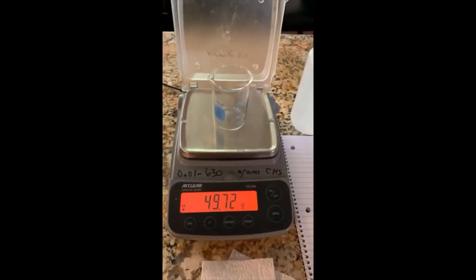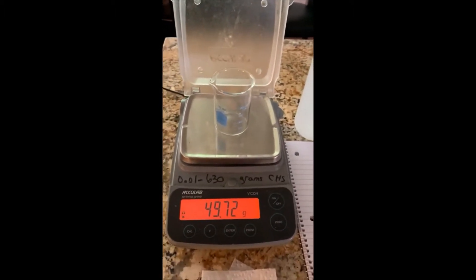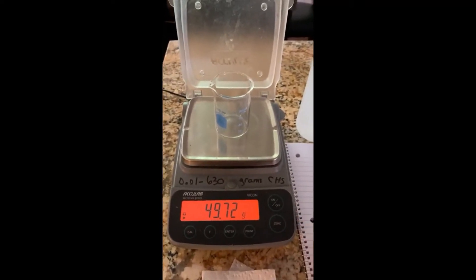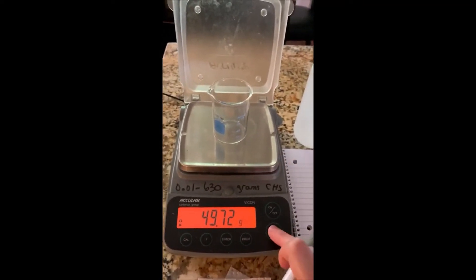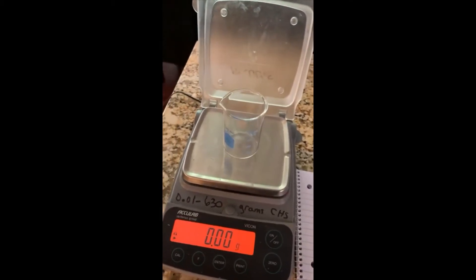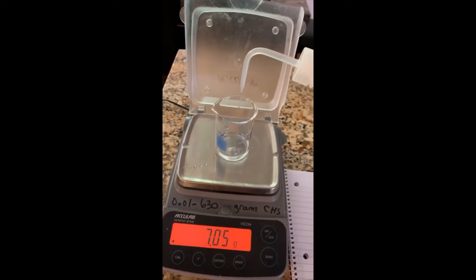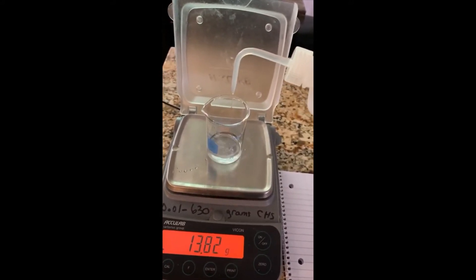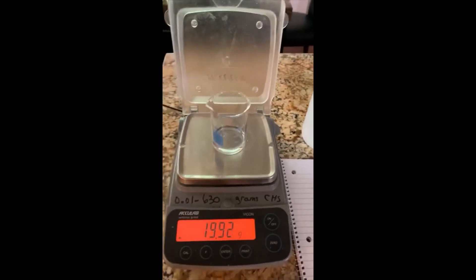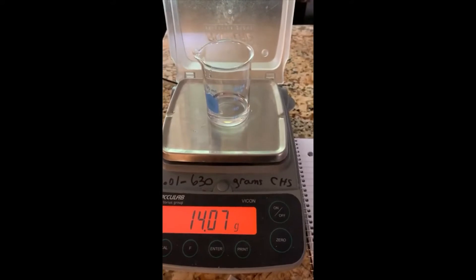There are two things that we can do here. I'm going to show you two methods. Method one: put the beaker on, hit the zero button, and then put the liquid in. Oops, I got some on the scale. Maybe I want to know how much that liquid mass is in there — I'm just going to write that down.